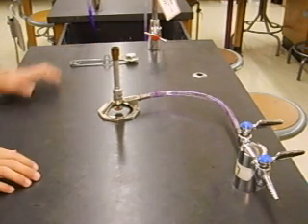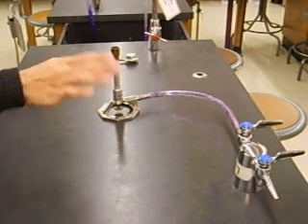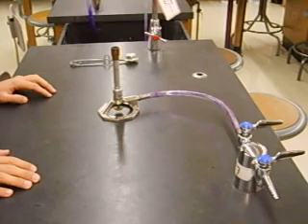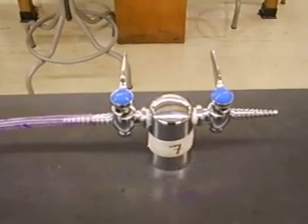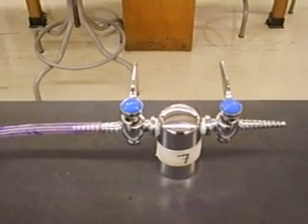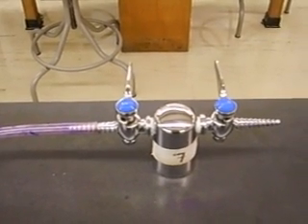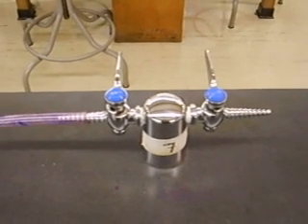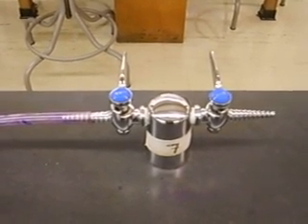So the first thing to know when lighting your Bunsen burner is how to turn on and off the gas. The way this works is that if the handle of the gas is perpendicular to the spigot, it means that it's in the off position. So both of these right here are in the off position currently.